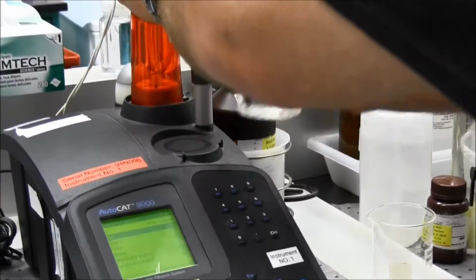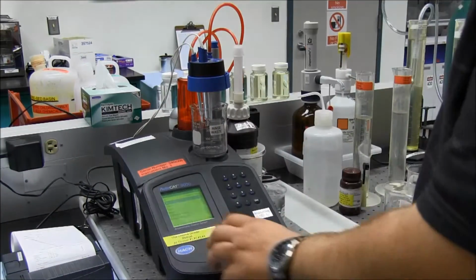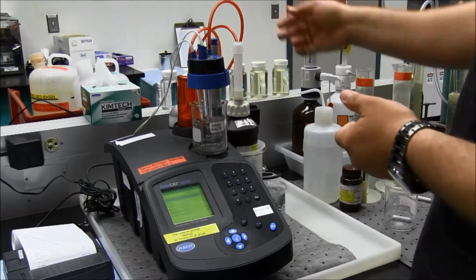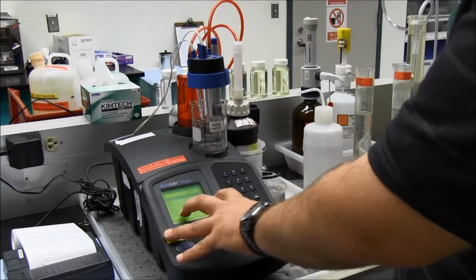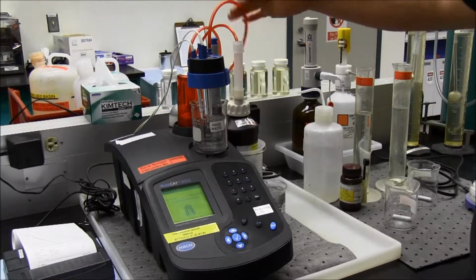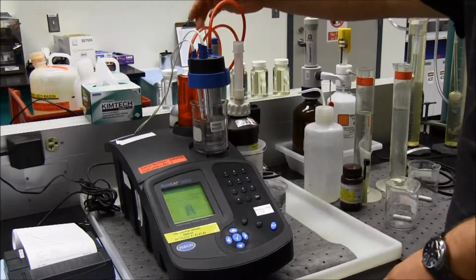I'll pull this out. This is my storage. I'll put my rinse waste in there, and I'll want to empty this back here to make sure that it pushes all the air that could be trapped in there, and then it will draw more titrant out of these lines from this bottle. So I'll go empty, and that's number 2, and then you can watch it empty. And as you're doing this, it's always a good idea to tap these lines. If there is a trapped air bubble in there, it will work its way out.